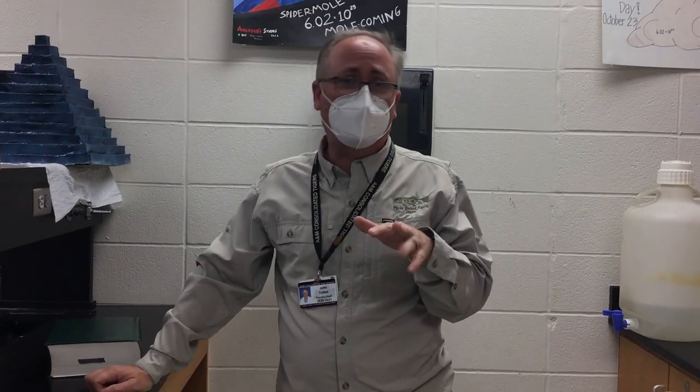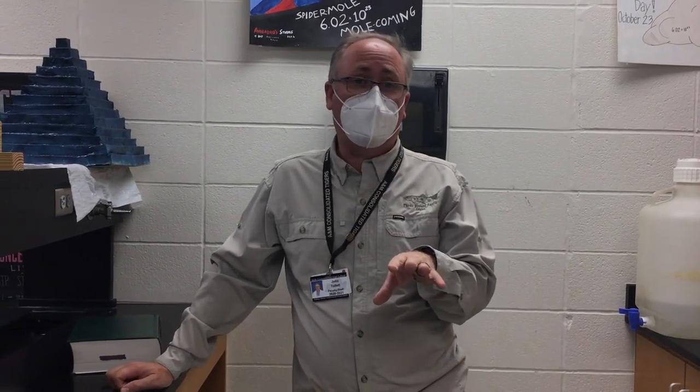So that was all 5 of those. Make sure that you have the slopes of each of them. You do need the initial and final temperatures of both of them. On the first 3, you may have to go back and look in the video and see where they were because I didn't point them out. I apologize. But there you go. So that is the first part of the lab. I'll see you guys in part 2 of the lab.